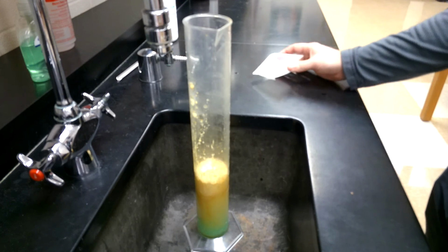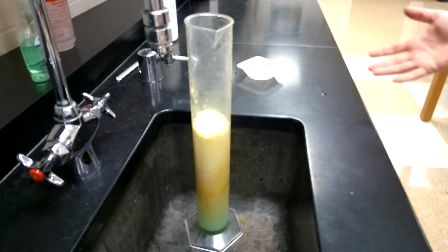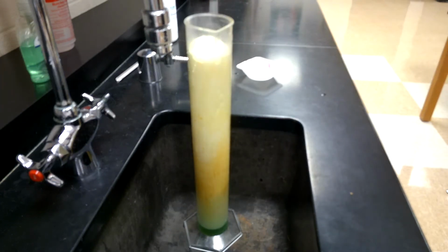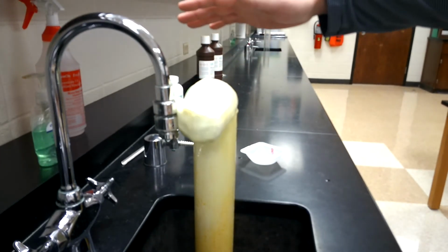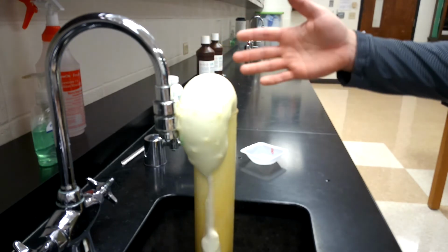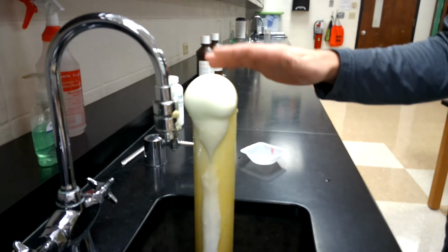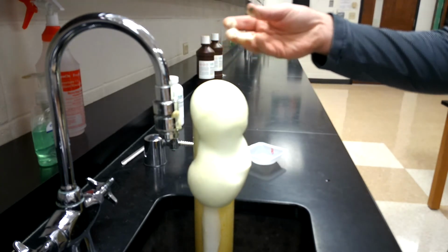Goes in, and it bubbles. There's also steam that comes off the top here. I know that's a little bit harder to see on the camera, but it is steaming. If you're in class, I'd actually let you come in. It stains the skin a little bit yellow for a day, but it's still kind of cool usually to touch warm bubbles. It's kind of fun to play around with.